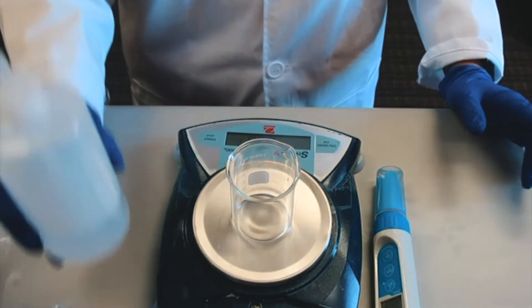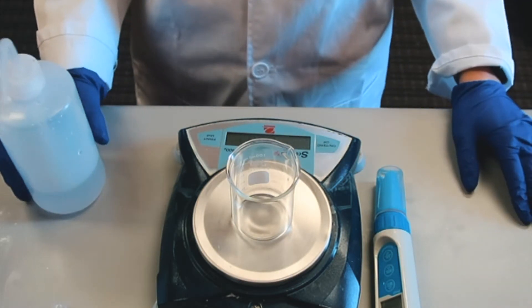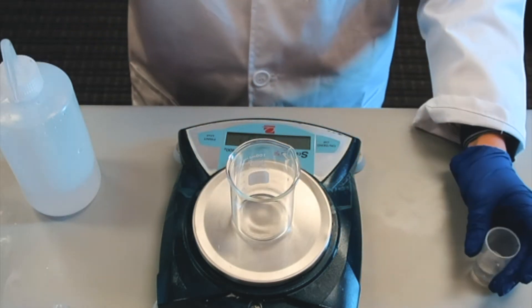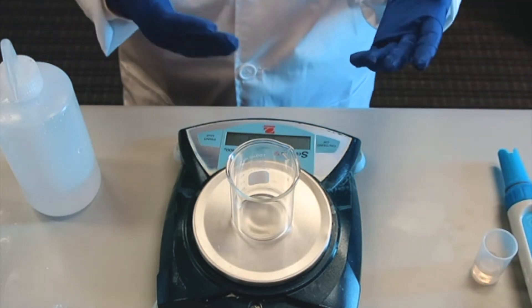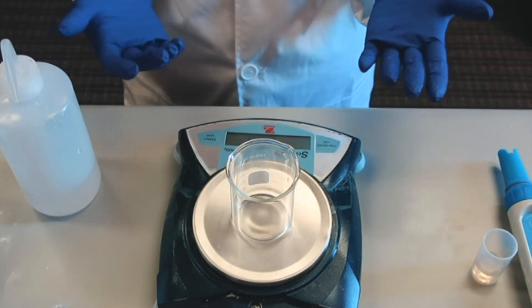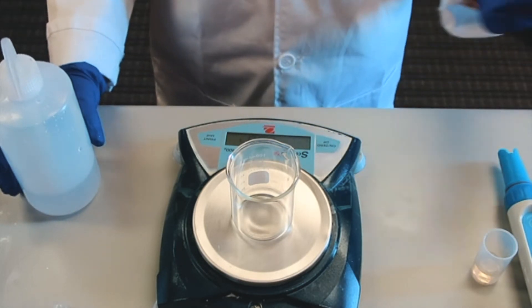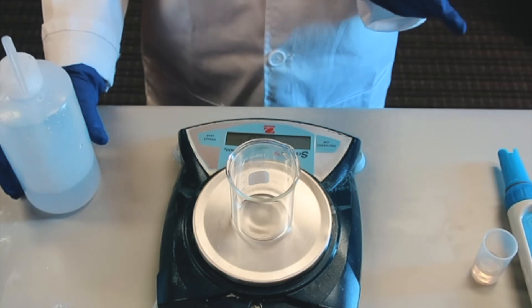The way you want to measure the pH of a cream is to first dilute the cream in some water. This is because the cream is a semi-solid product, so it's going to be difficult to measure the pH just by sticking the pH meter directly into the cream. A common question I receive is: if I add water to the cream, would that affect the pH? The answer is no, because I'm diluting it with distilled water, which has a neutral pH, so I'm still going to see the pH of my cream.